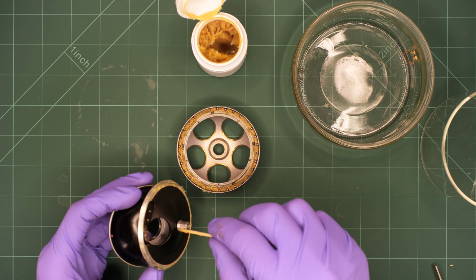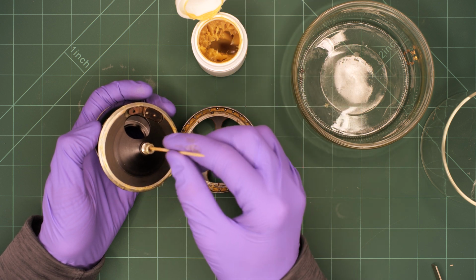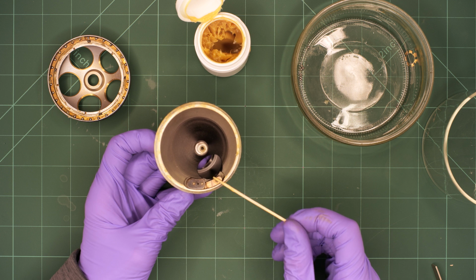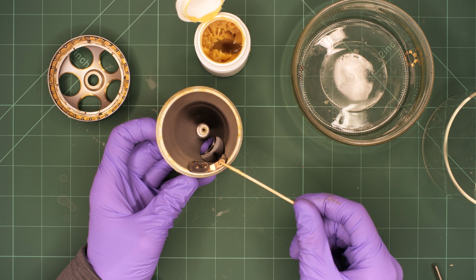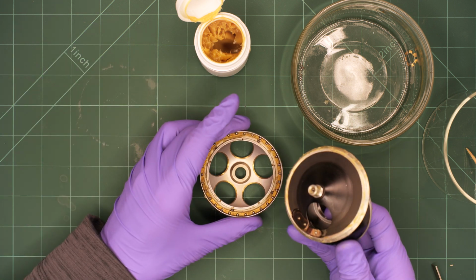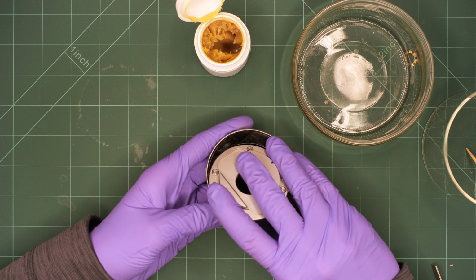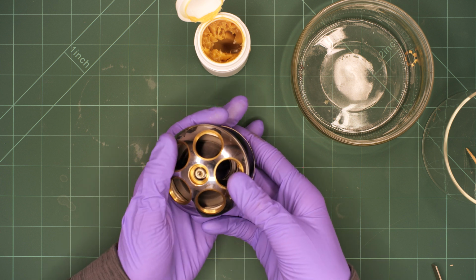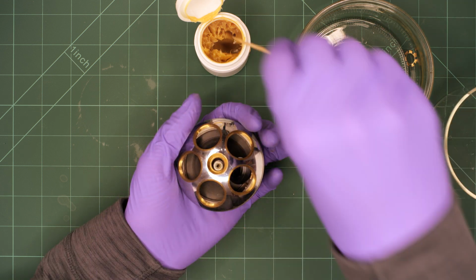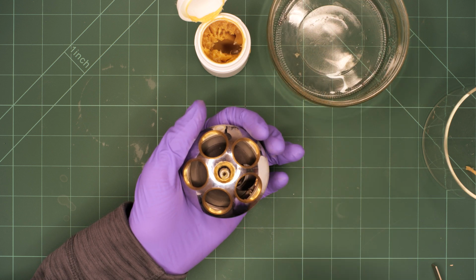We also add some grease to the outside and inside thread. It's also important to not forget the metal ball that is placed into the indentation of the spring steel. We now press both parts together while making sure to not move around too much to prevent the ball bearing from escaping from its assigned position in the brass ring. In case the ball bearings escape, you will have to separate both parts again and place the metal balls back to their position. The small ball bearing is now reassembled by adding grease, the brass ring and the ball bearing.